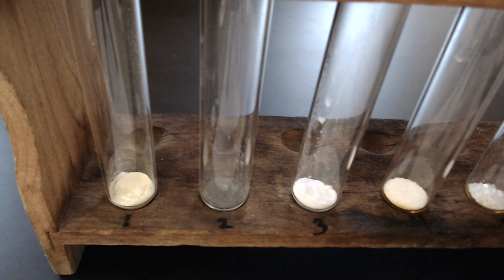Okay, so now we're back into the test tubes, and we're going to be doing step number 4, testing for solubility. Solubility meaning dissolve or not dissolve. Okay. And I know that we said that we were skipping the odor, so step number 3, and that is true. Fortunately, you're not missing much. The only one that has an odor is chemical number 1, sulfur. Sulfur is actually added to propane so that propane has a smell. So if you think about what propane smells like, a little bit of rotten egg, that's the smell that sulfur has.